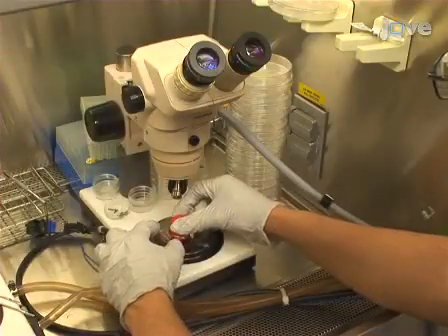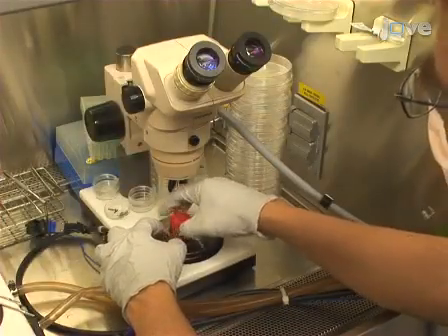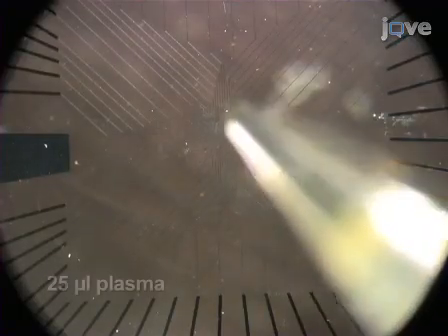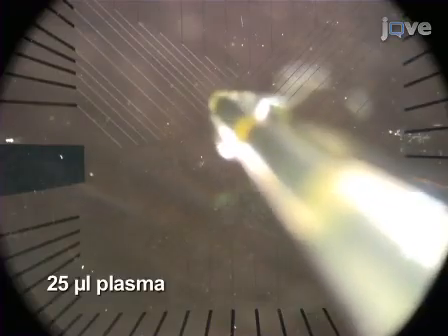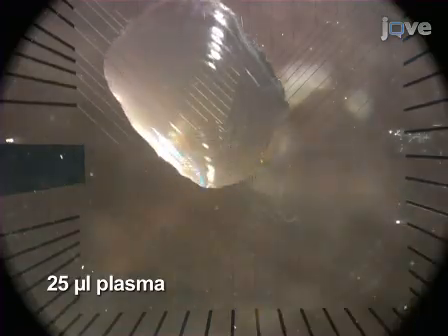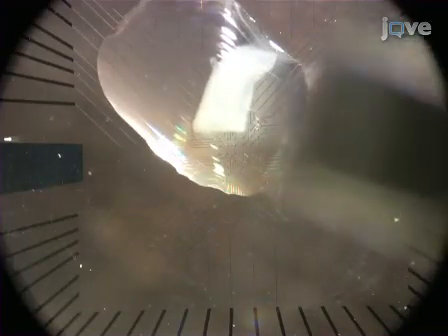To begin mounting the tissue in the MEA chamber, first position the MEA at room temperature under a stereo microscope with the electrode array in focus. Then center a 25 microliter droplet of plasma on the clean, dust-free and sterile electrode array matrix. Using a small spatula, carefully slide a cortex and VTA section into the plasma droplet.